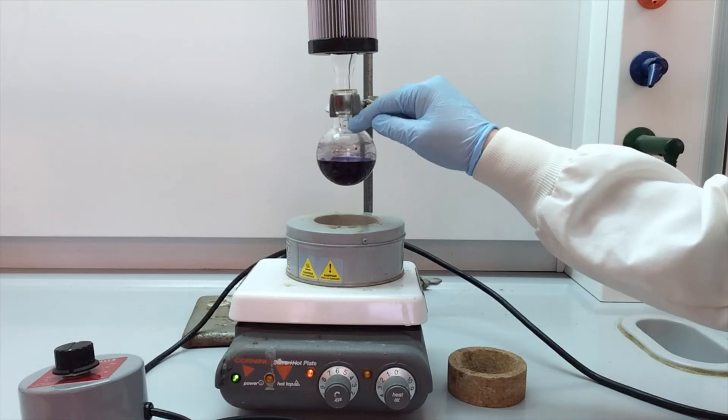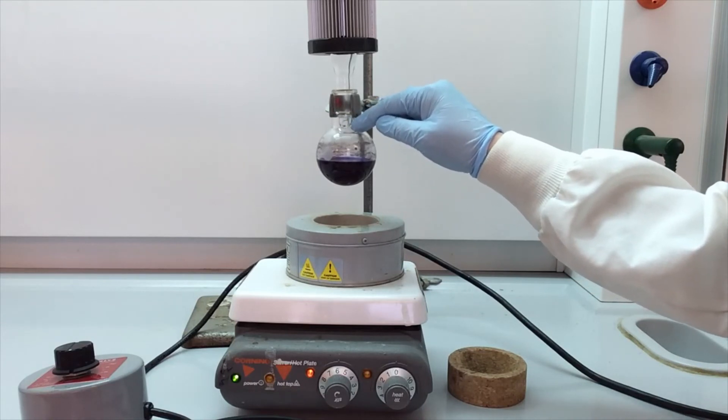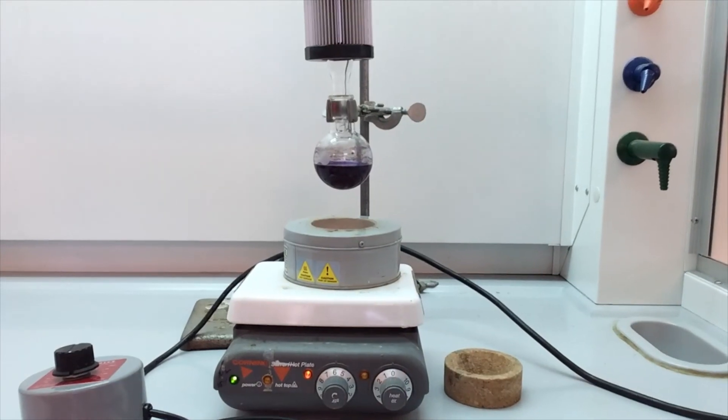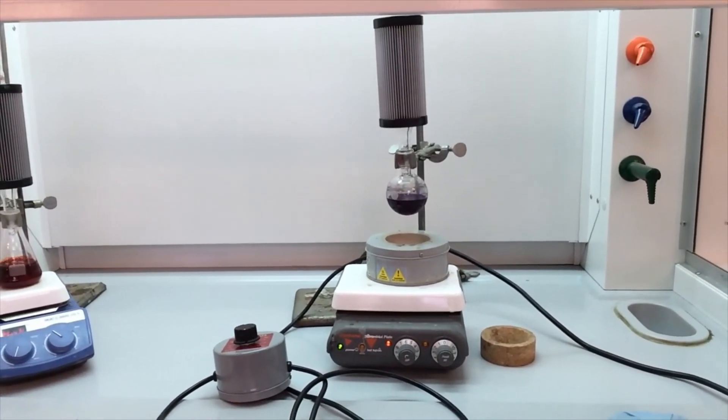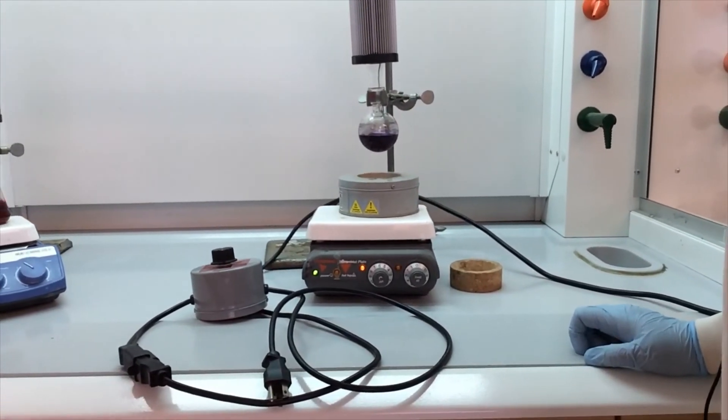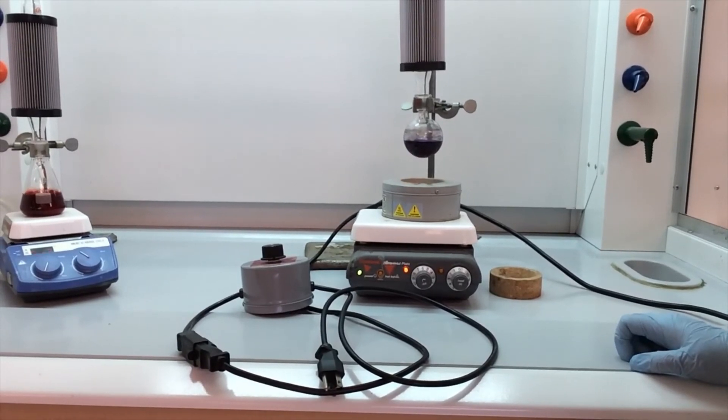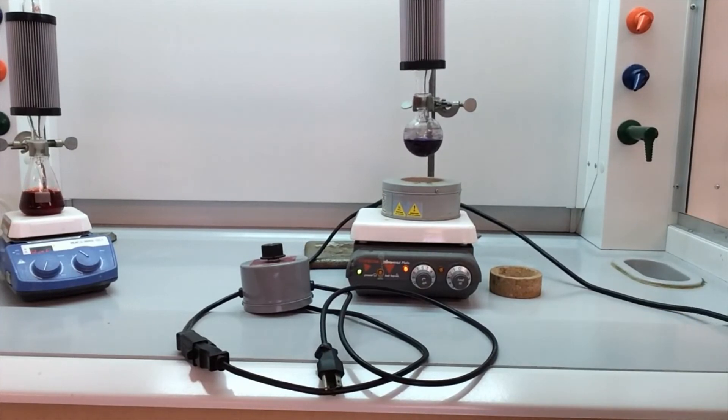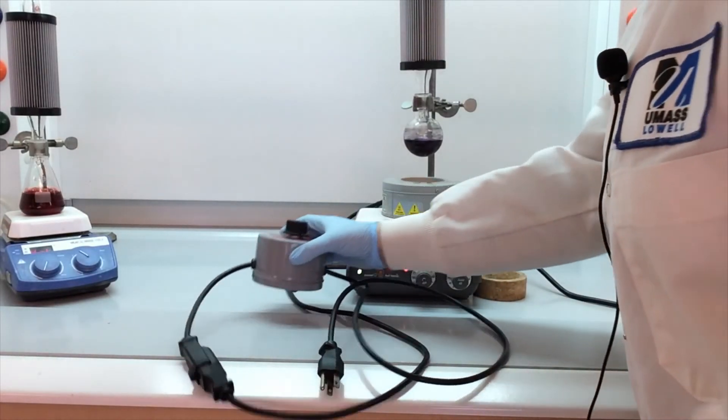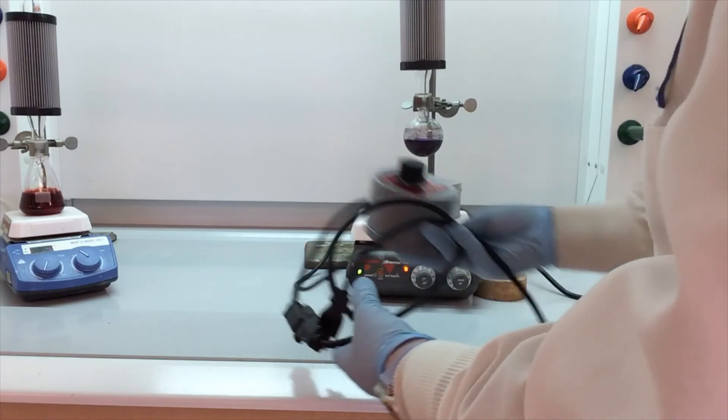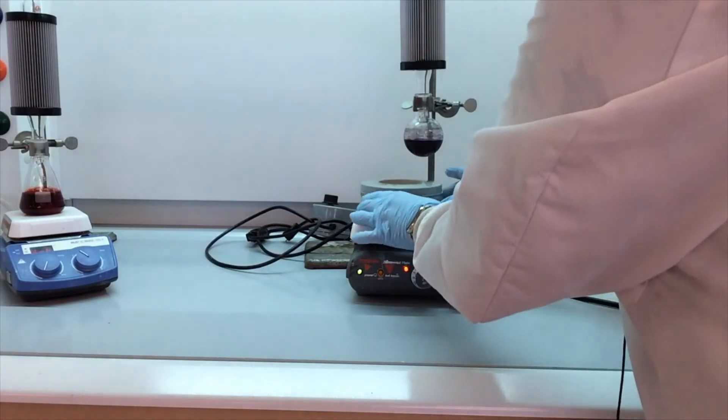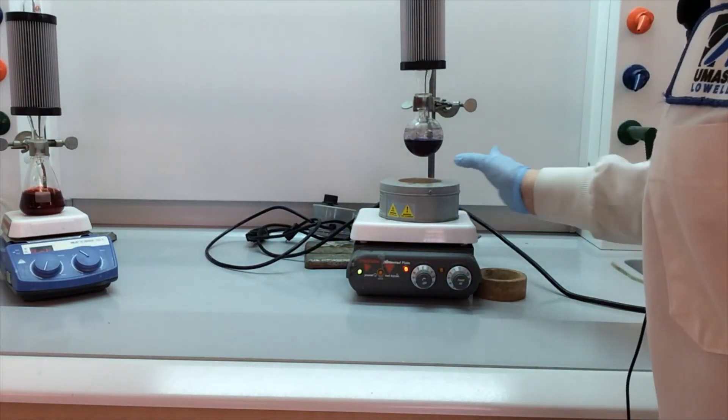Let's see. Looks like one more little droplet wants to drop. I'm done with this heating mantle, so I'm going to set it in the back here. This is still hot, so I'm just going to leave that.